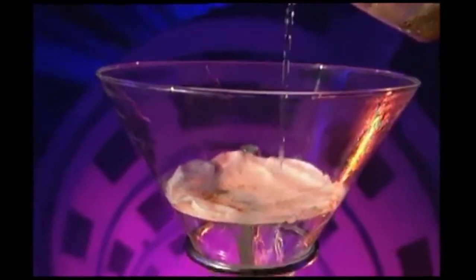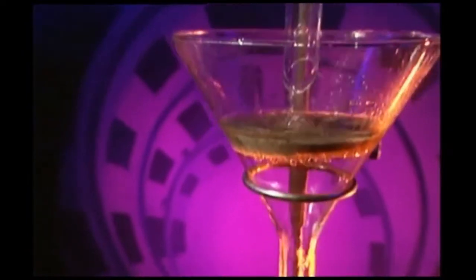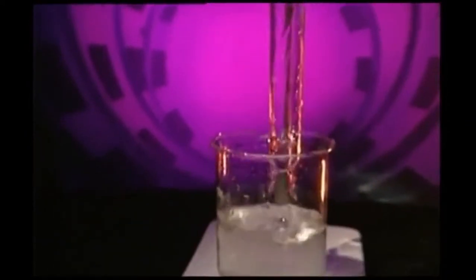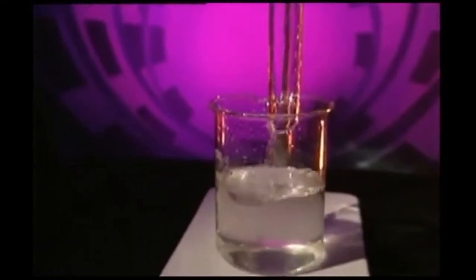It's easy to separate the sand from the water because unlike water, solids can't pass through tiny spaces. So by pouring the mixture through different filters, the sand grains get trapped while the liquid passes through to the beaker. Separating a mixture like this is called filtration.